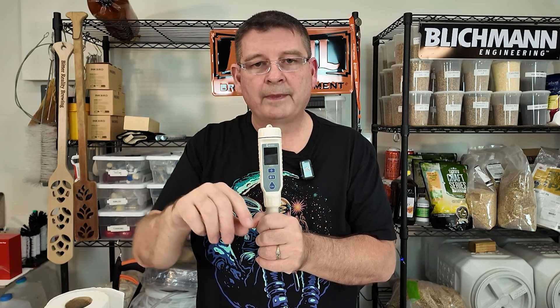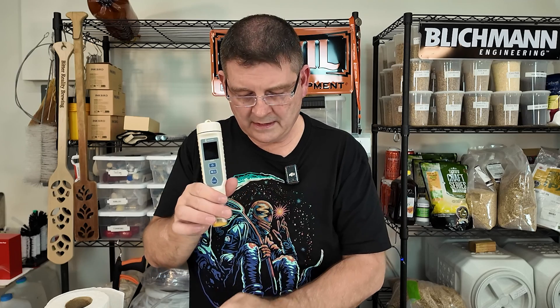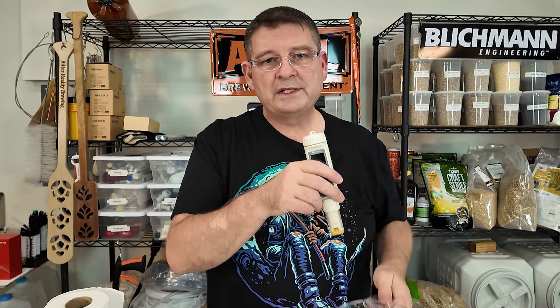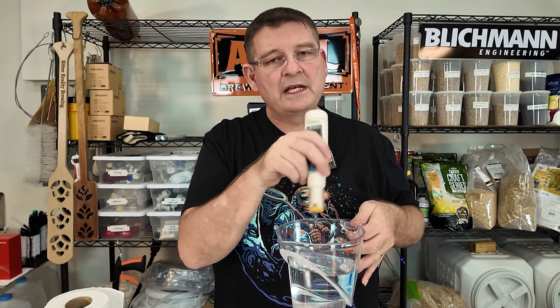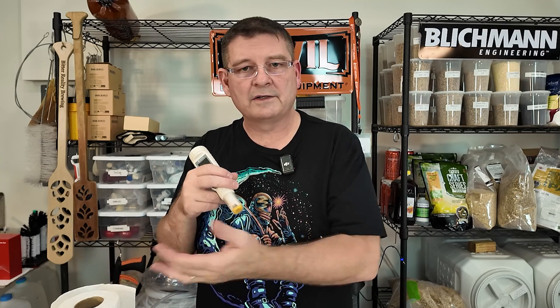When you get to the last one, the last one always seems to take a little longer. It'll keep going, it'll finally give you the pie, it'll say it's calibrated, it'll stop. You take it out. You want to rinse it in that distilled water for a full minute. It says to wipe it off, but I'm okay with just putting it in a solution. My fear is that a paper towel or something could cause more damage. From other instructions, I would stick to just don't touch it — just make sure it's rinsed really well.